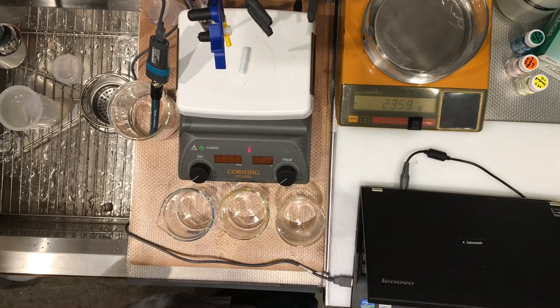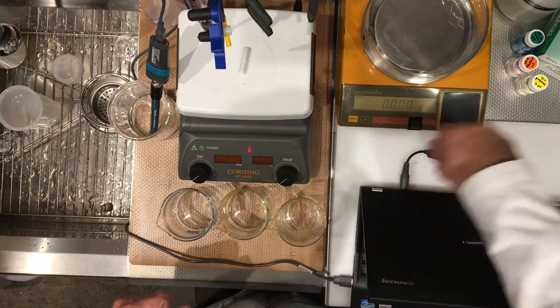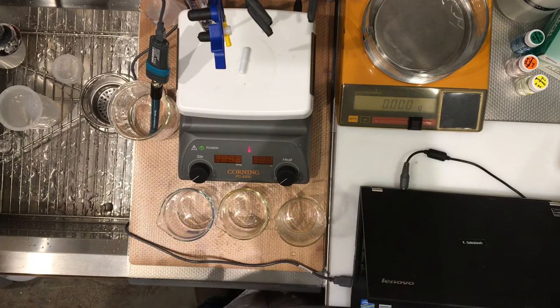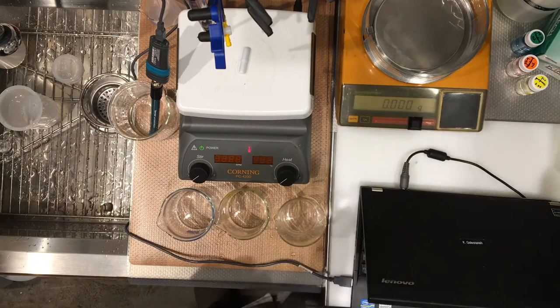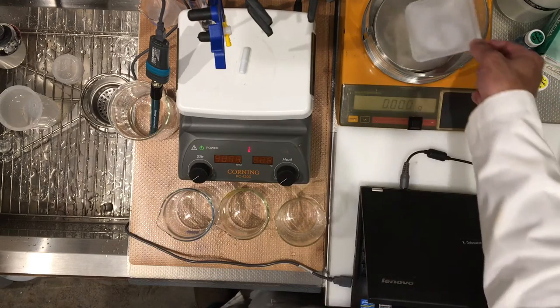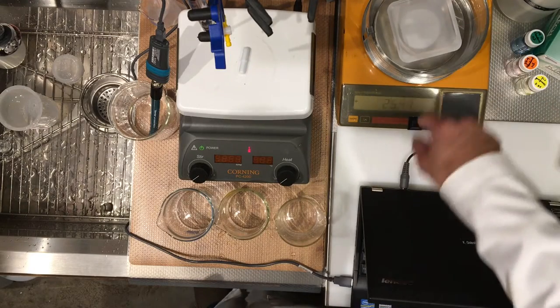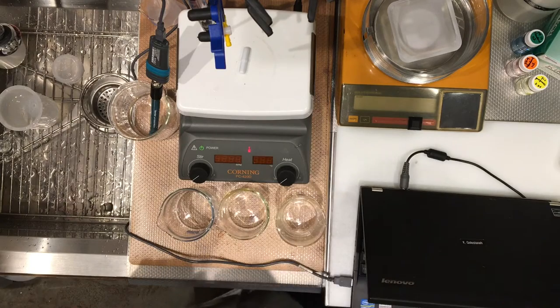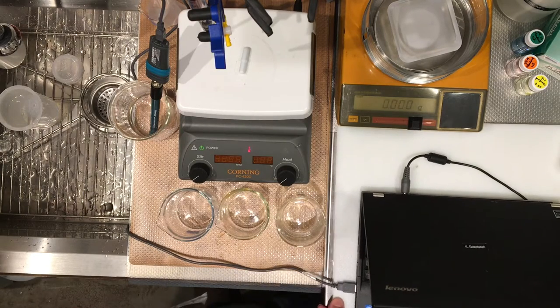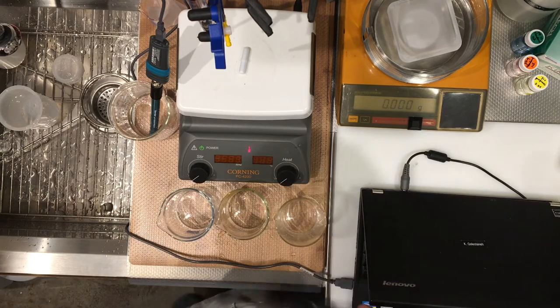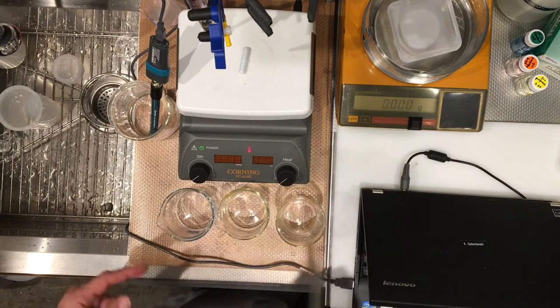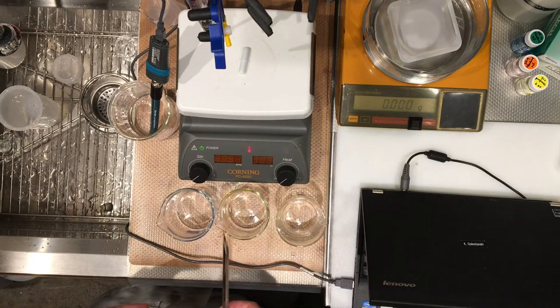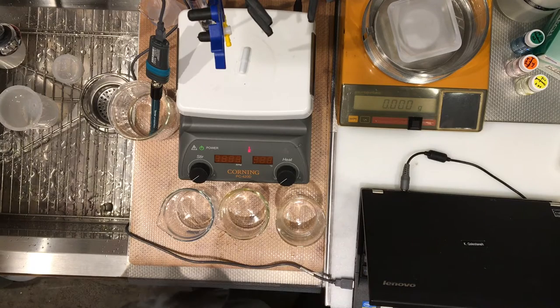And so let's move on. So here we have our work. So we're going to use a plastic weigh boat, and we will zero the mass of the weigh boat. There you are. And I have a spatula, so I'm going to weigh. This is beaker number one, beaker number two, beaker number three.